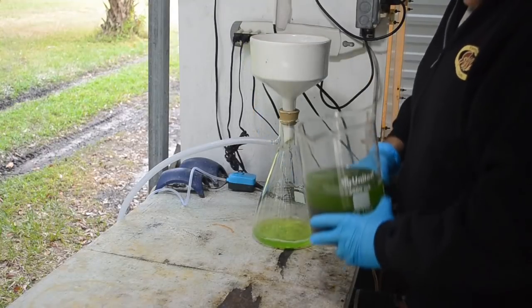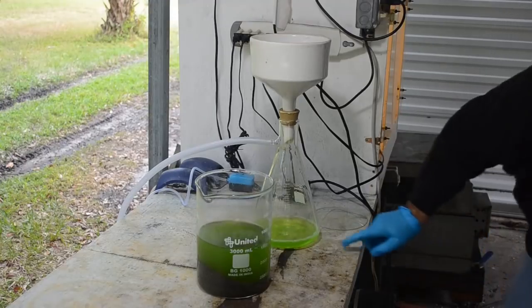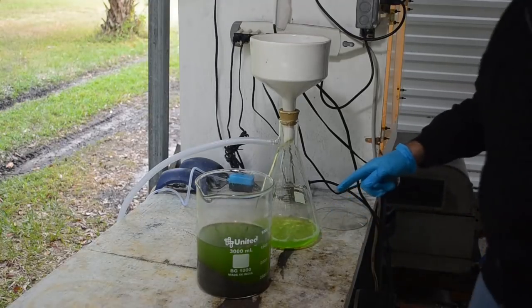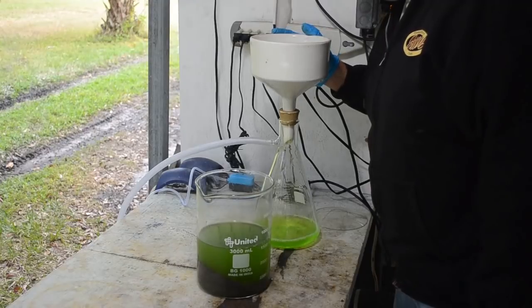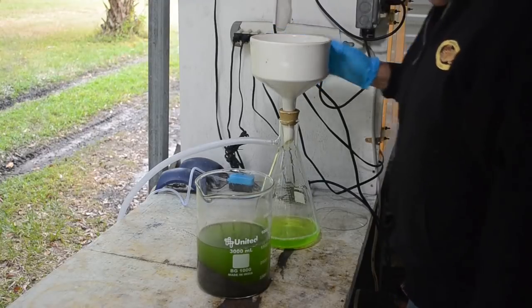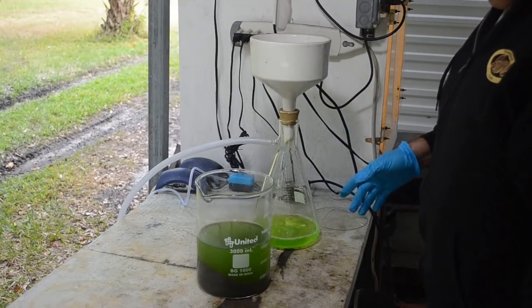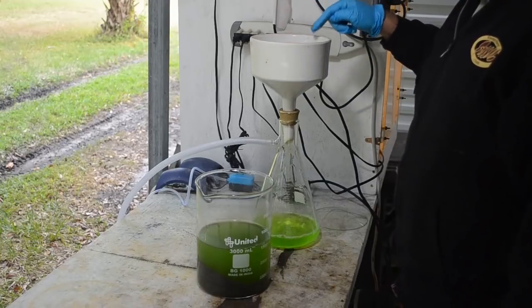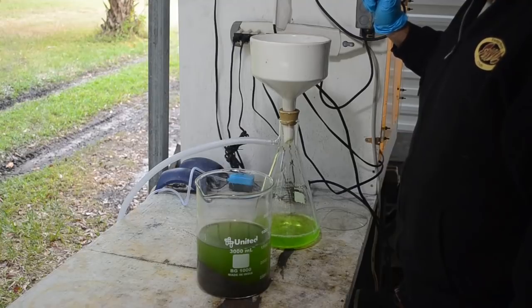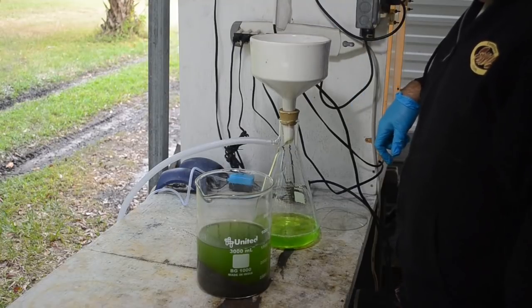And I'm going to run the liquid through before I get the solids into the filter to dry them out. So, yeah, I will probably have to run it through again. It looks a little cloudy. So I will run the liquid through. Yeah, the filter's catching something. So I'll probably have to run the liquid through a couple of times. Make sure it's good and clear. Then I'll dump the solids in here and let the vacuum pull the liquid out as I'm pouring distilled water on top.